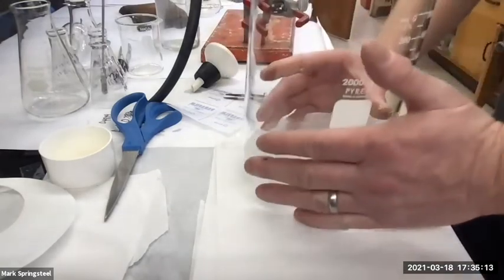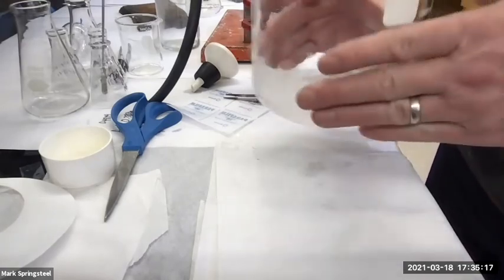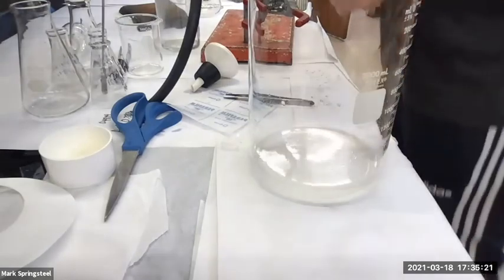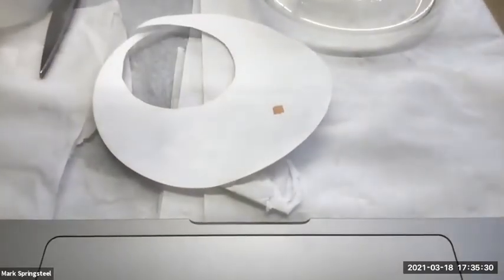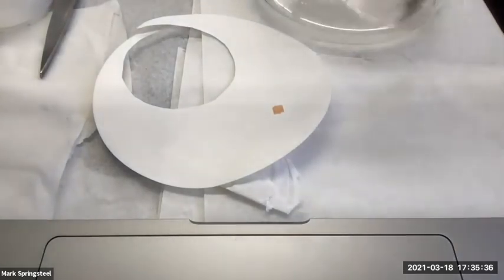Okay, so I quenched the acids and bases, and the base. When you quench a base, it's not as obvious to tell. I do have sodium bicarb still in there, so I feel like I did a good job. But with bases, sometimes I'm extra careful and I say, you know what? I want to make sure I quenched it. So I'll just do a little pH paper. Easy enough, right? Doesn't take long. And I'm being good about using tiny bits of pH paper, so I'm not wasting too much. Big spatula here. Swirl it around.